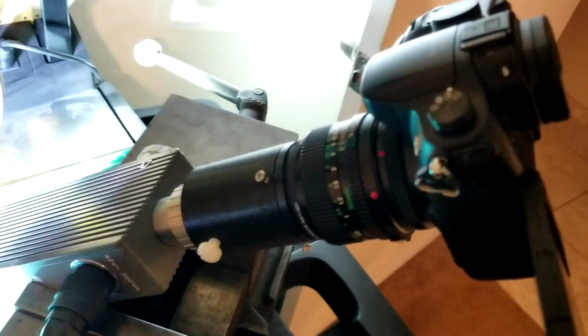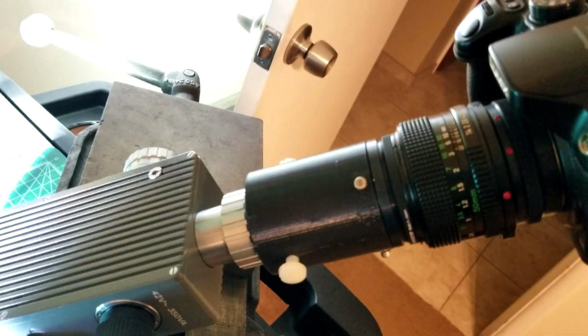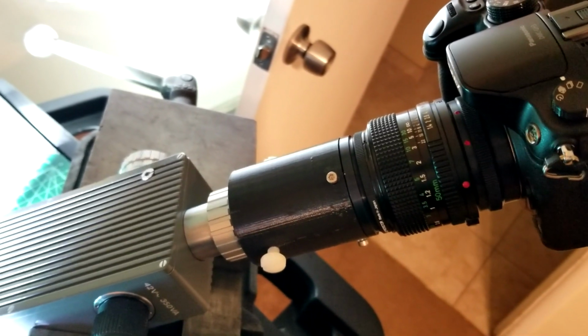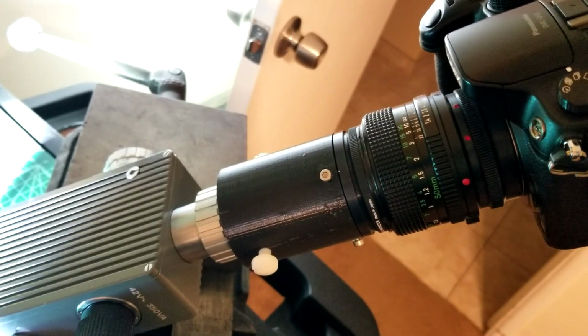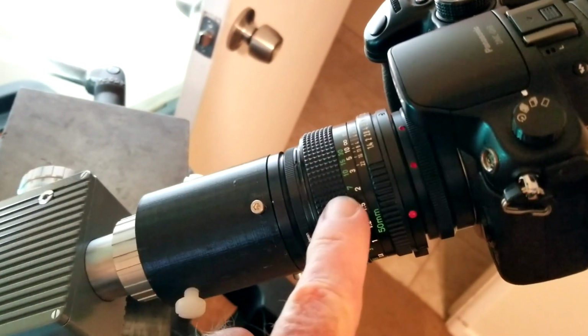But anyways, I made this adapter for it that you can see right here, so I don't have to use an eyepiece, which I found to be very difficult. That's a 50 millimeter lens on this adapter here that I made.